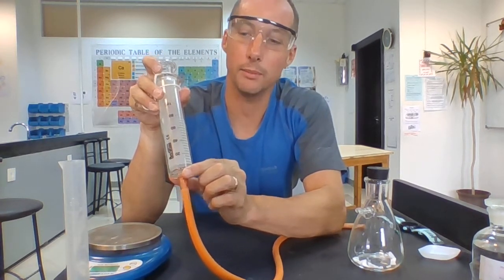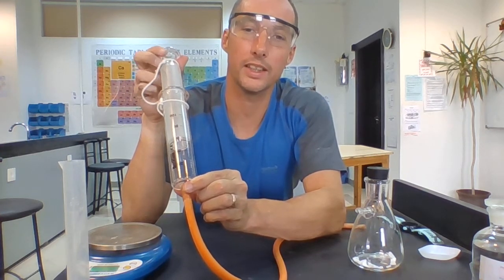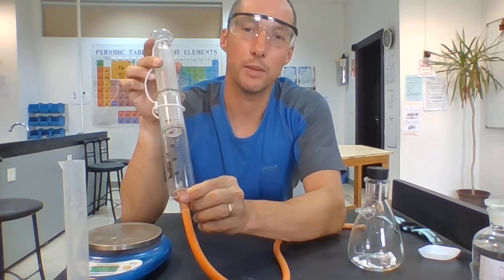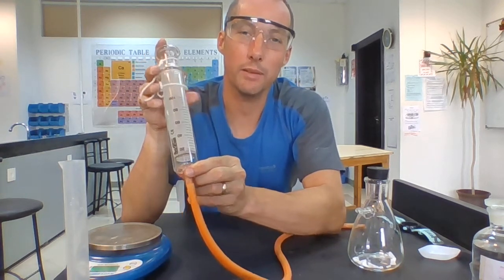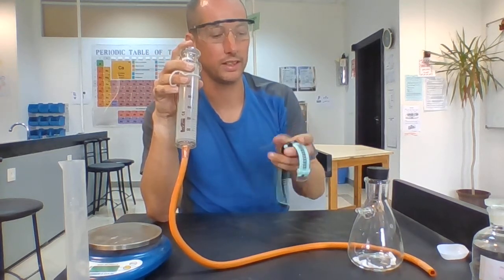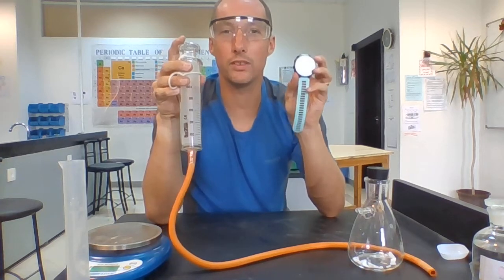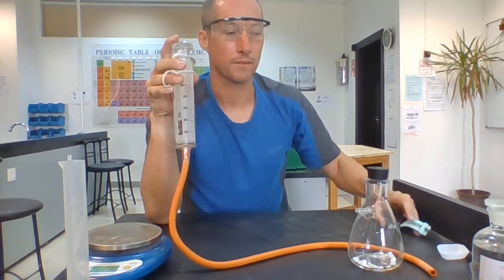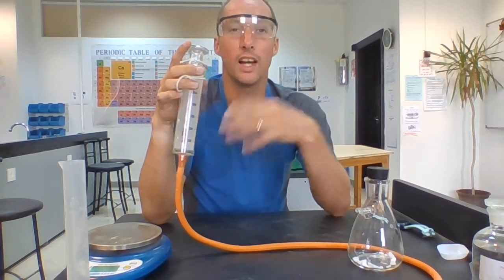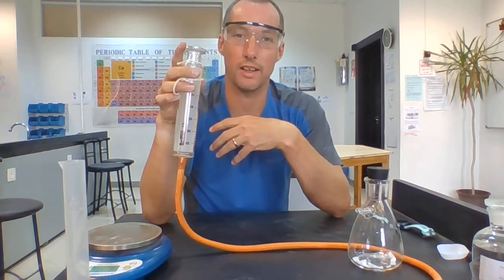But as the gas escapes out, the syringe will get pushed upwards by the gas that enters it, and it will tell me how much gas we've produced. Now what I'm going to be doing, I'm going to use my stopwatch, which is my watch for today, and I'm going to be looking every 10 seconds at the volume of gas that I've produced. So after 10 seconds I look, I leave it another 10 seconds, I look, and what I can get from that is an idea of how much gas is produced in a certain amount of time.